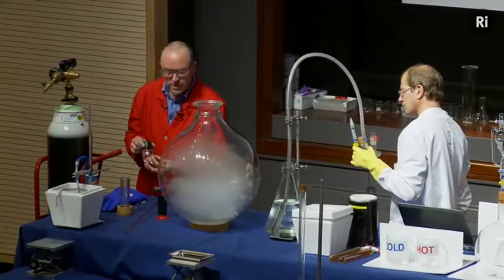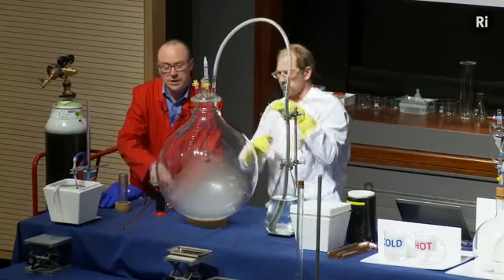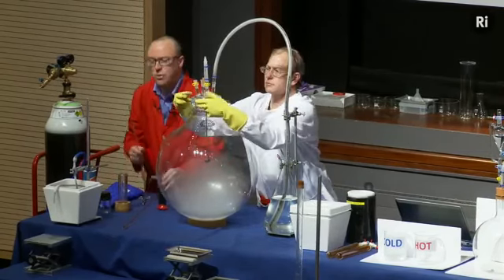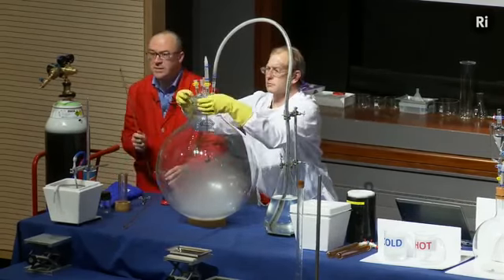So I'm going to fetch out this piece of white phosphorus, and we're going to put it in a little spoon that's suspended from the lid of the flask. Okay, you can see the phosphorus is smoking already as it comes into contact with the air. And that will probably catch fire sometime in the next few minutes, but just to help it along, I'm going to take a glass rod and heat up the end of the rod, and then just touch that against the phosphorus just to get things going.